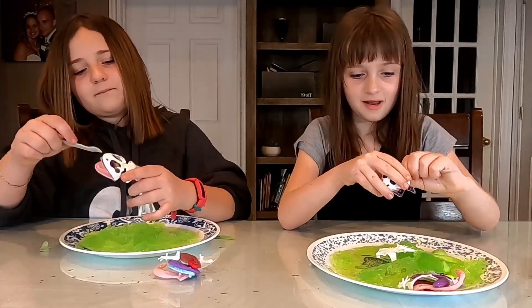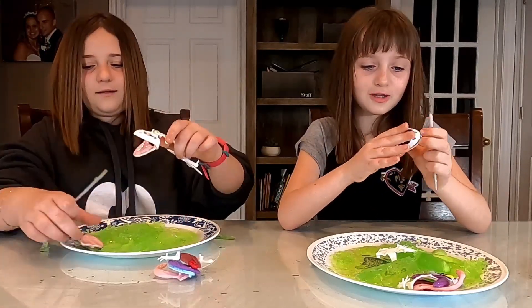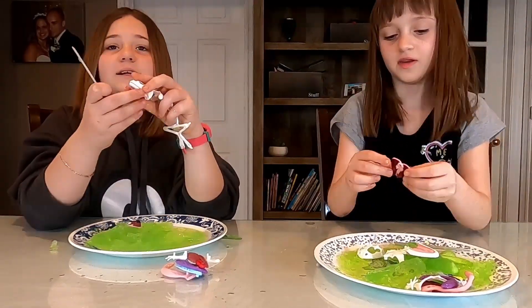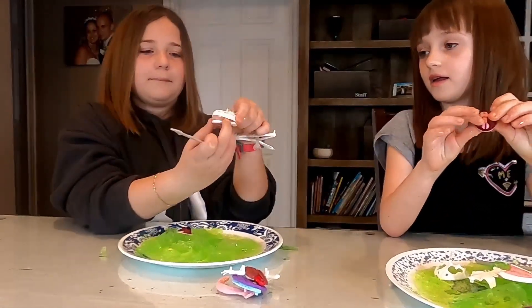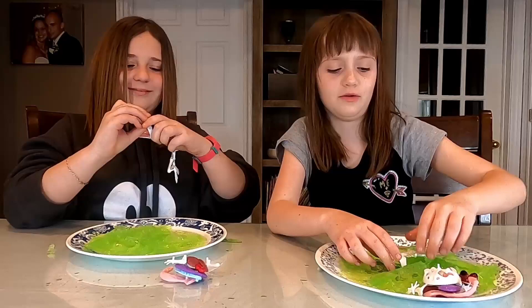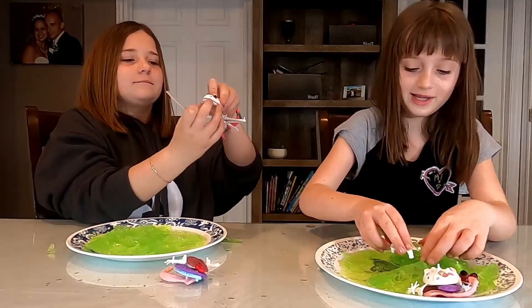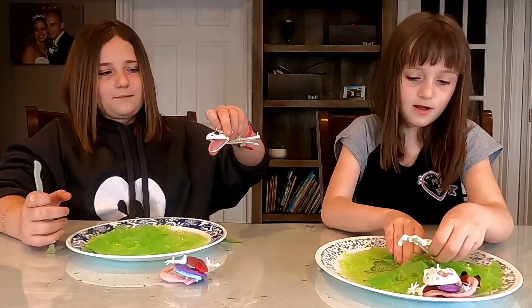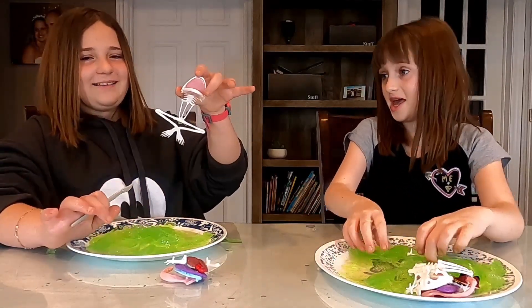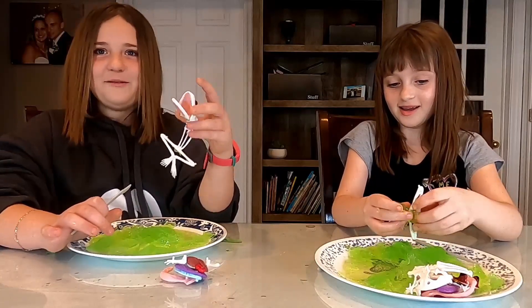So what do you got right now Miley? I got the whole thing. I got its jaws there though. Alright, Alyssa's got the whole skull bone apart — good job. And you got the eyeballs out. Eyes, the spine thing, skull bone. Very neat. Good job ladies. I got its rib cage. Mine didn't go apart — head start for me! I got its feet. And you got its feet. I'm done.